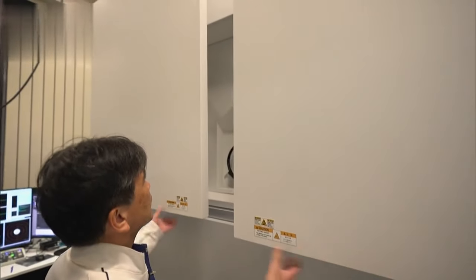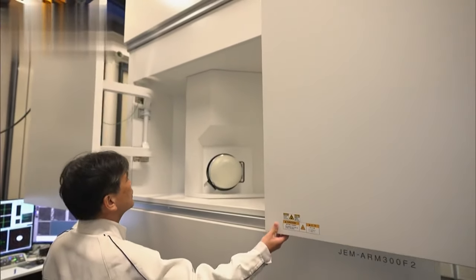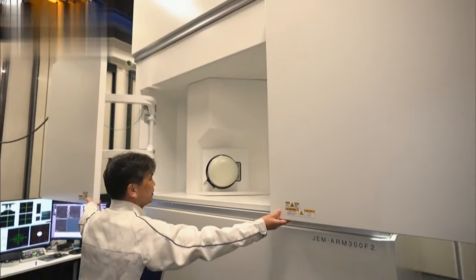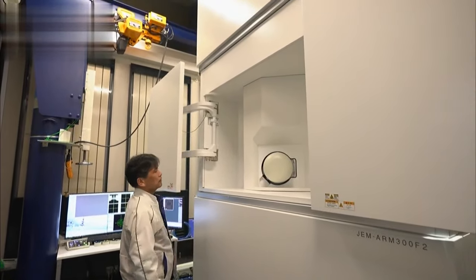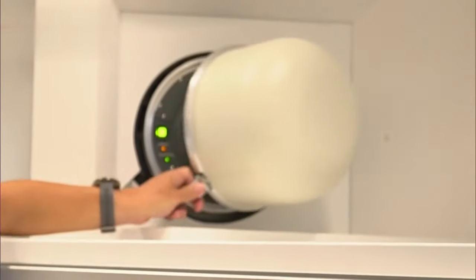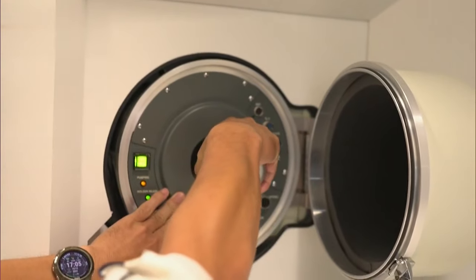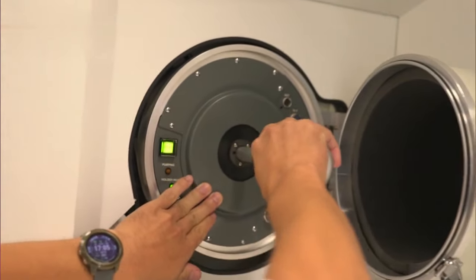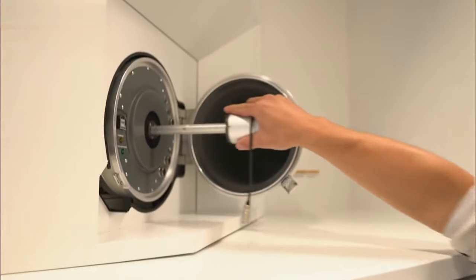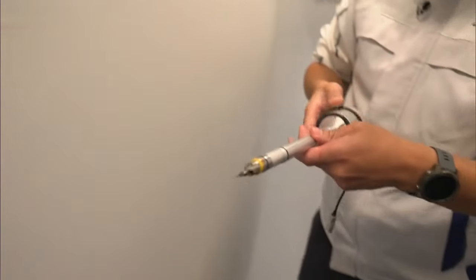This is the actual machine inside. A rod-like tool is pulled from the machine, and the sample is set at the tip of the rod before being loaded in.